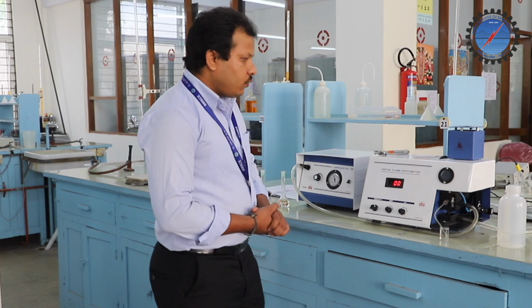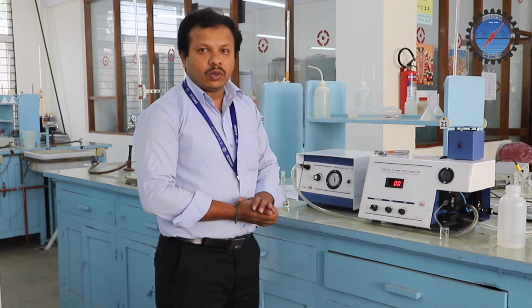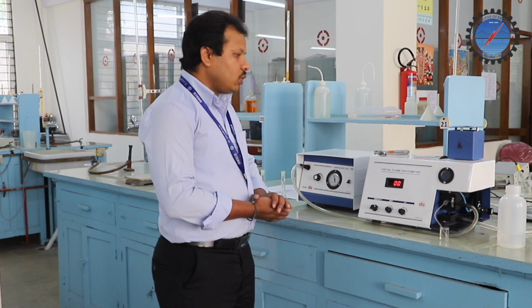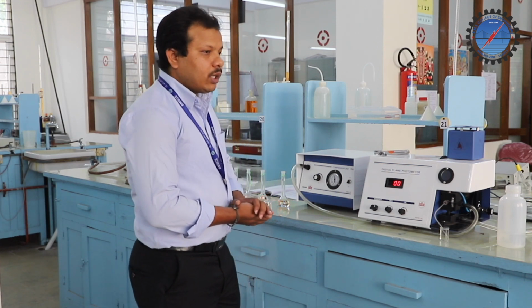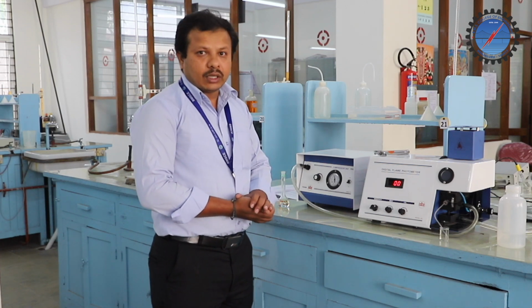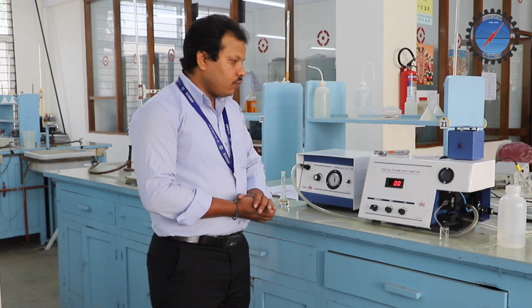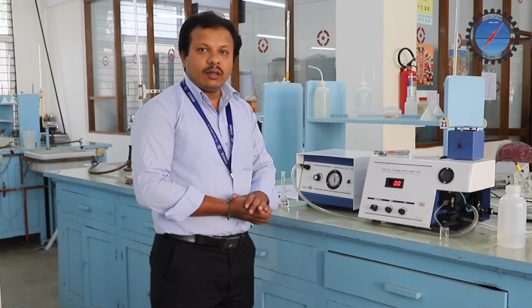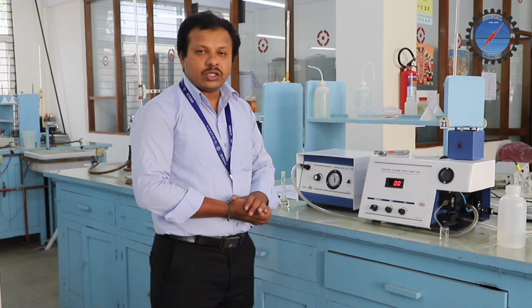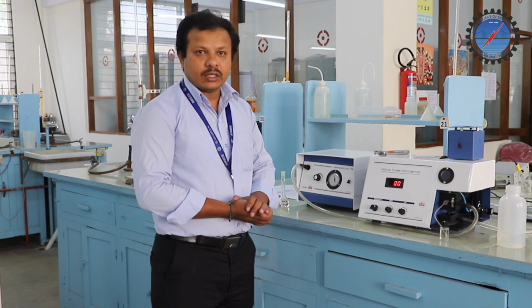So what is this flame photometry? The principle of flame photometry is very important to study before doing the experiment. Flame photometry is the determination of the intensity of light emitted by elements like sodium or potassium present in the given water samples.